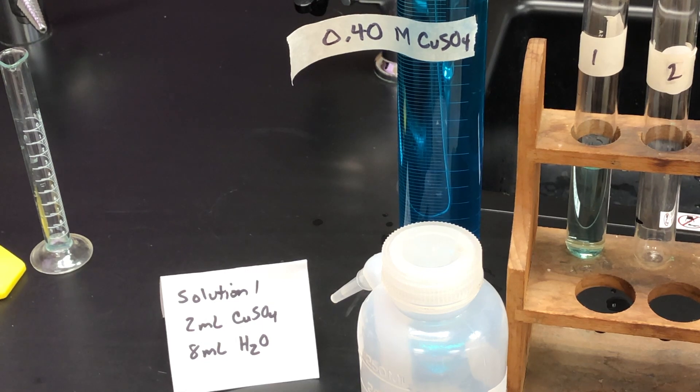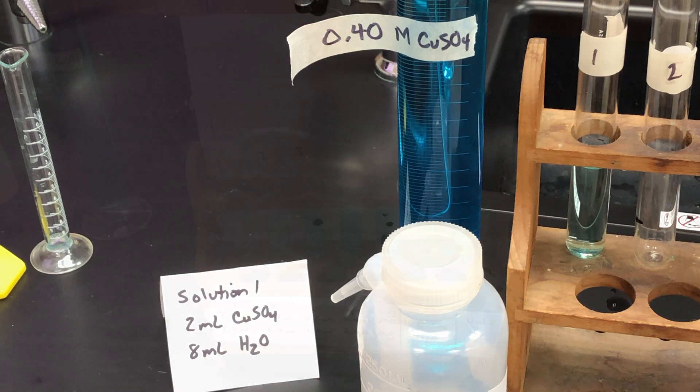So I'm going to start working on that, and why don't you calculate out how much the concentration is now after diluting it. There are a variety of ways that you can do that. In your living systems, or maybe AP Bio class, if you took that, they like to use percent as a way to track dilution. In chemistry, we do it a little bit differently, and I'll share that with you in the explanation in a little bit. So let's start mixing these solutions.